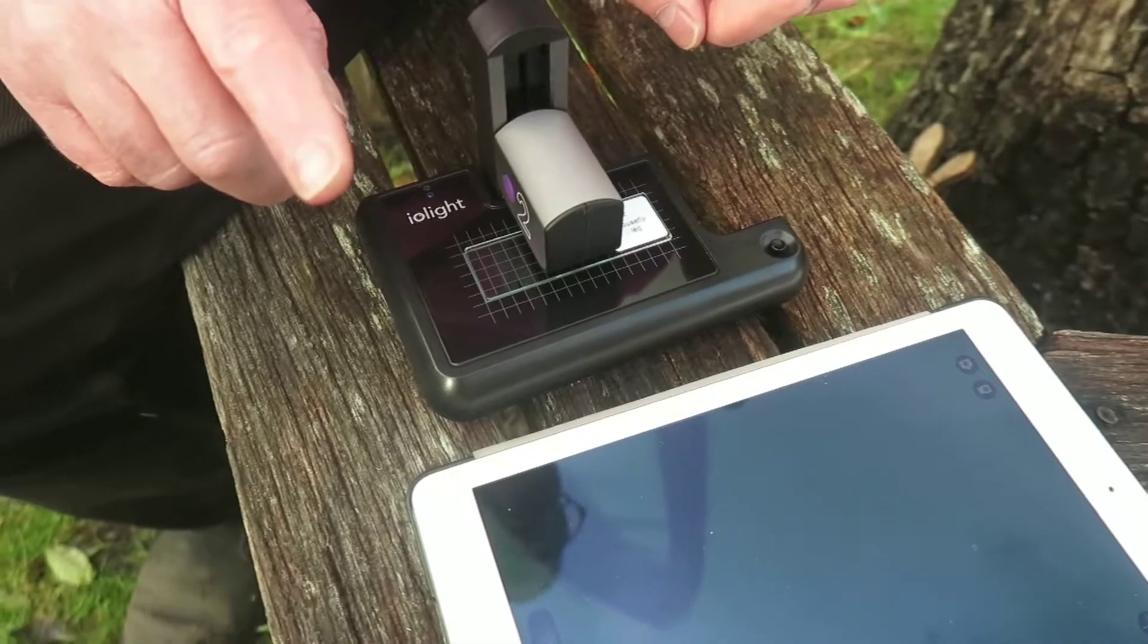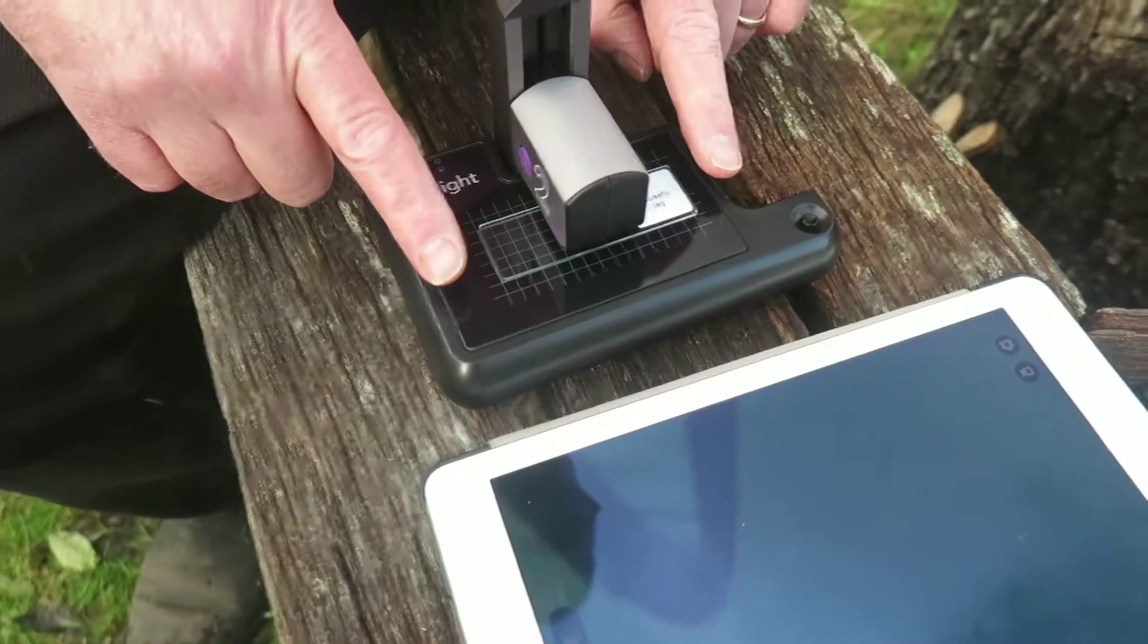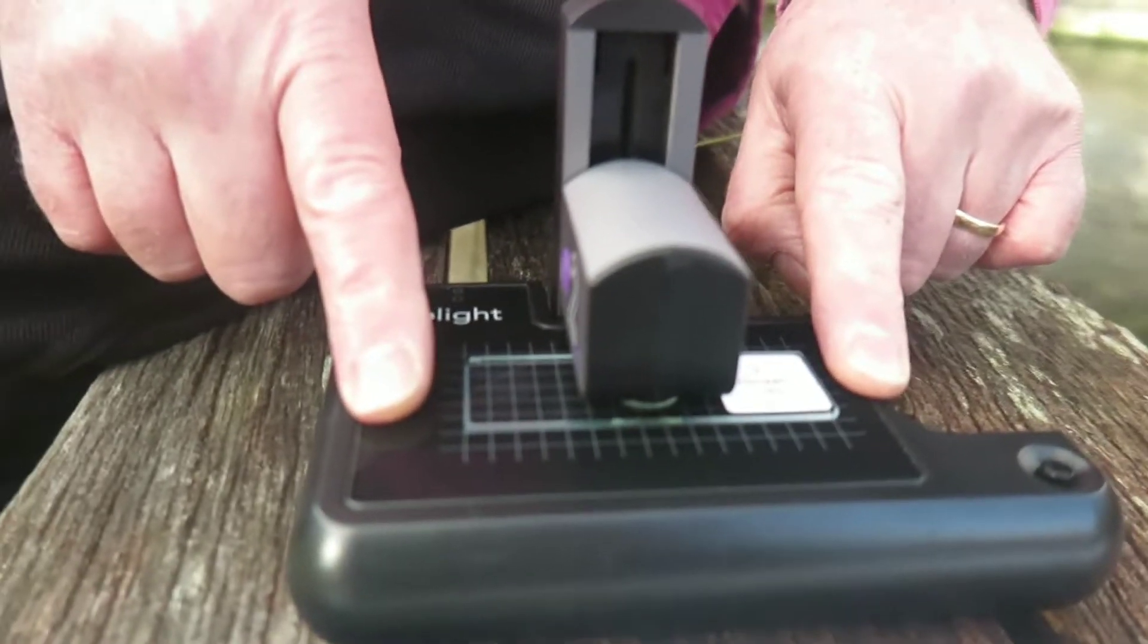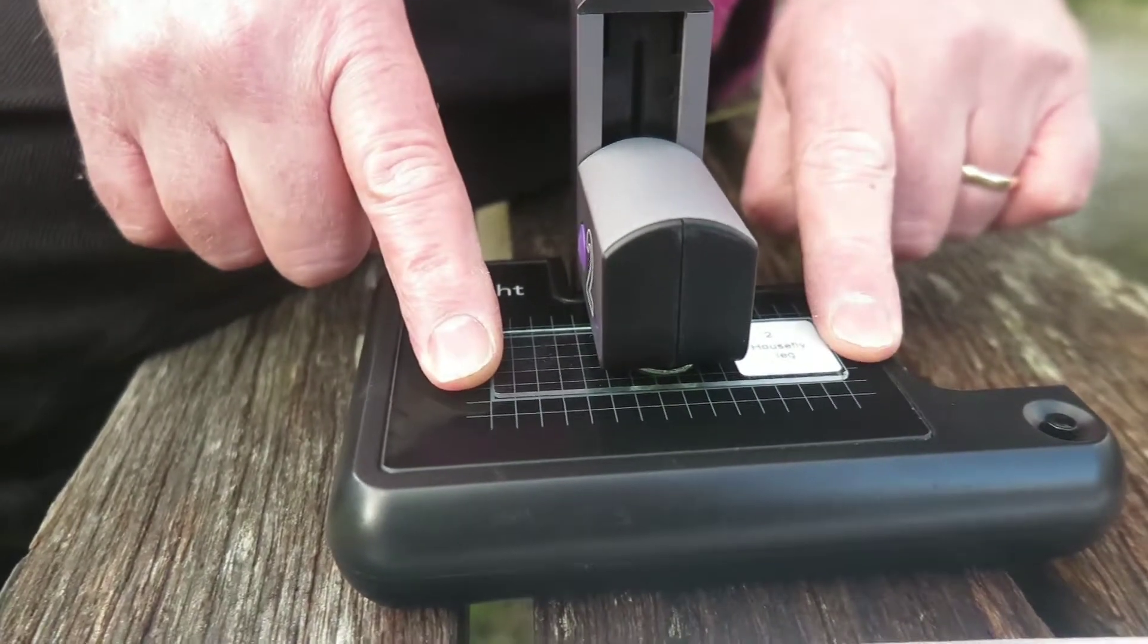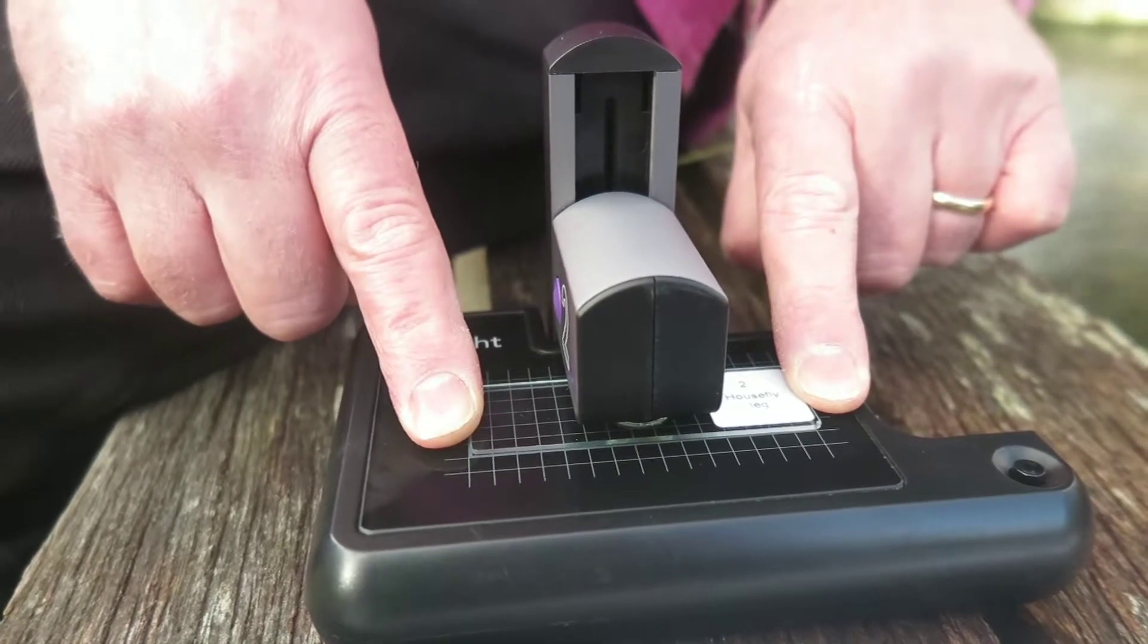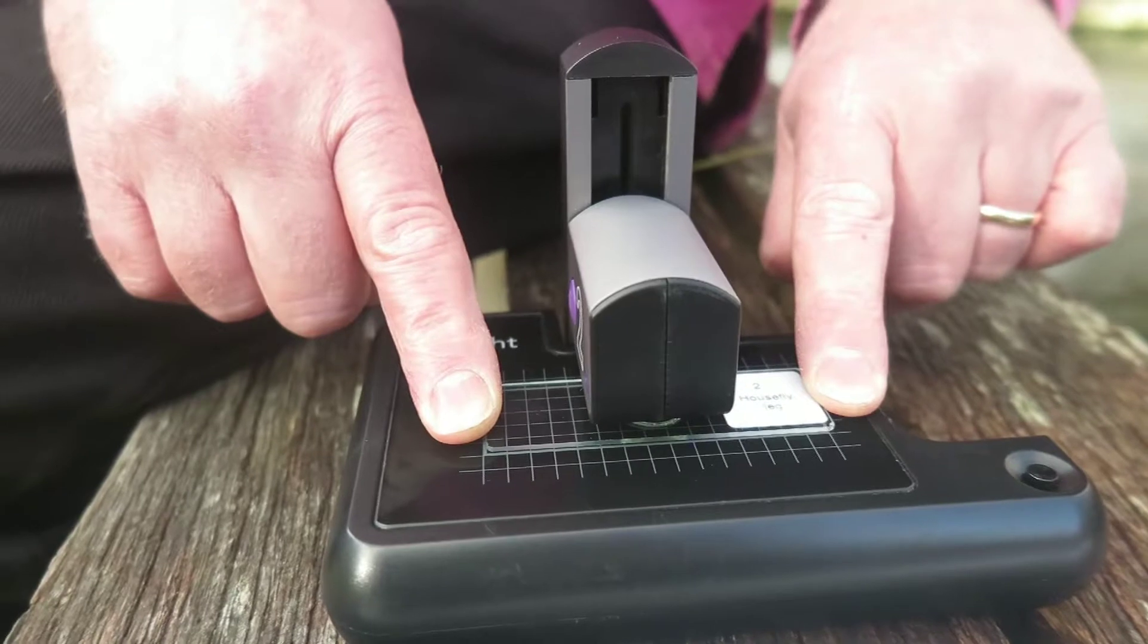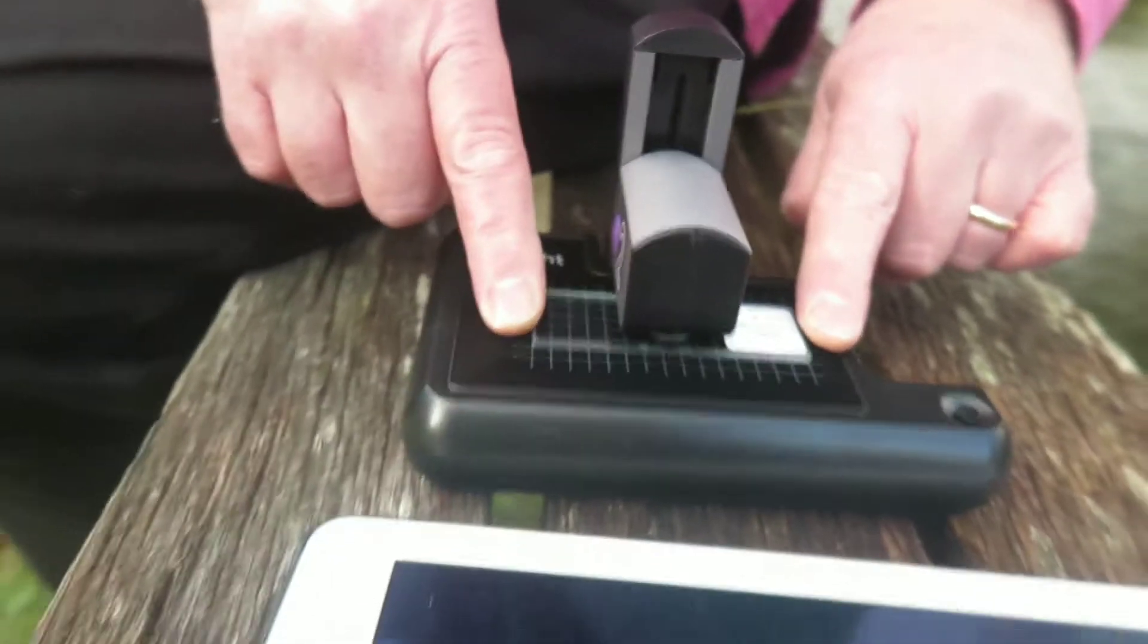So what I'm going to do is I'm going to put my fingers, two index fingers, two hands, one on either end of the microscope and I'm going to slide them in till they contact the slide. So now my fingers are touching both the end of the slide and the microscope so now I've got real control and actually it's very easy to move around as you would do with an XY stage.